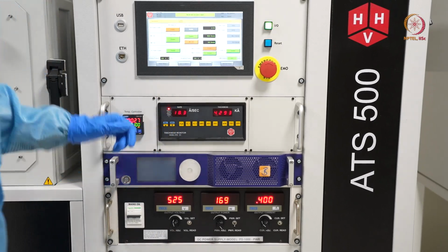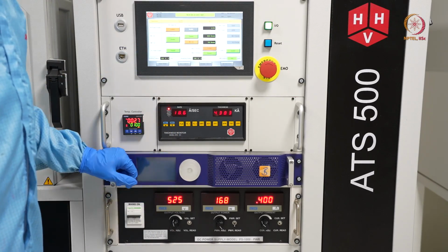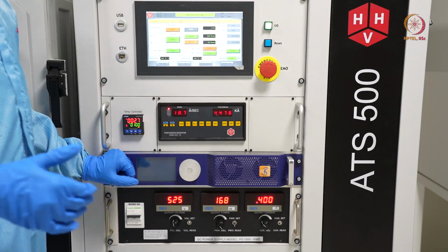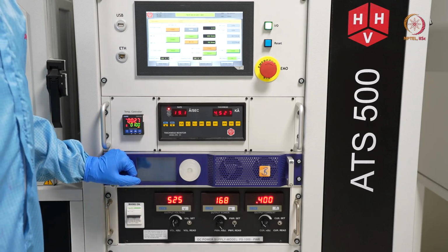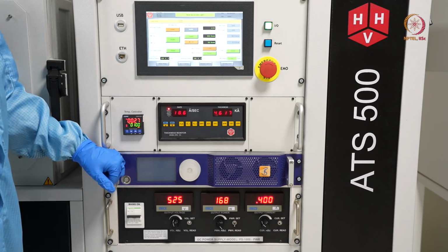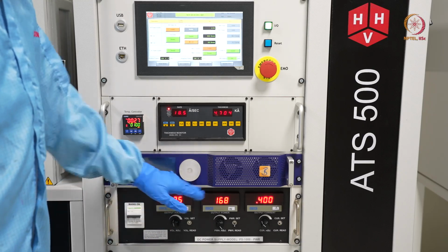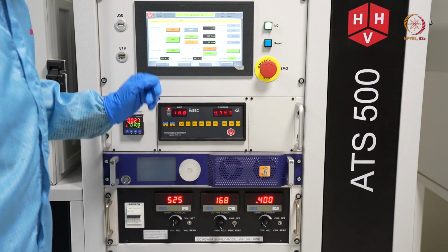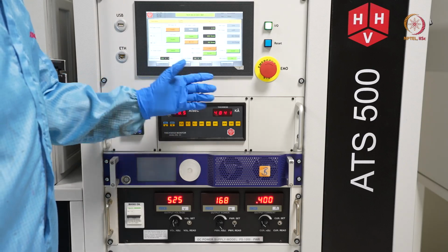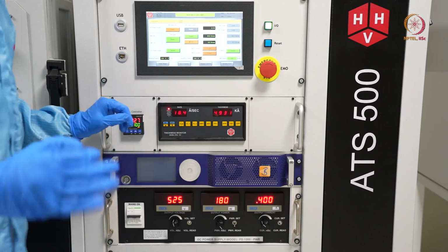Now the second thing is, after this deposition we will show deposition using RF power on the same sample only, because this is something that we are not using for any device purpose. This is just for demonstration, so we are using the same sample for both. So we will stop this deposition and then go to that. For that, the first thing you have to do is close the shutter, just the same as in the electron beam evaporation technique. First close the shutter, so the deposition will be stopped.